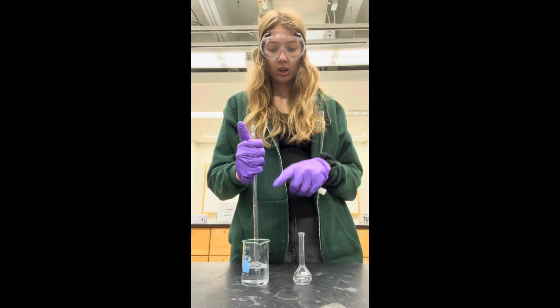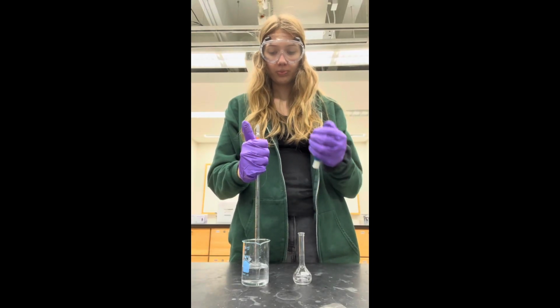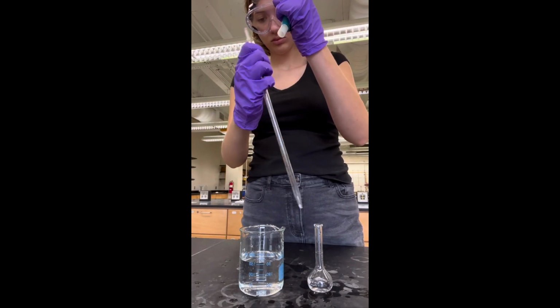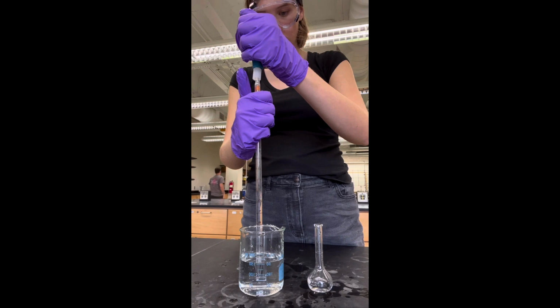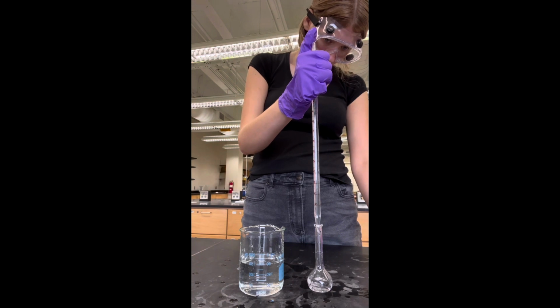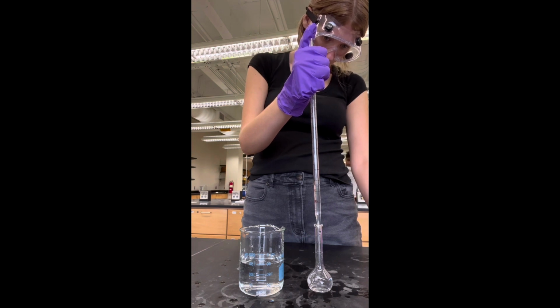Now I'm going to use water to dilute my dilution 2 up to the 25 milliliter mark. As you can see, I'm further diluting the already diluted stock solution in the flask. A stock solution is a concentrated solution of a known concentration that will be used for diluting. The diluted solution is a solution where water has been added to a certain amount of the stock solution in order to decrease the concentration and therefore dilute the stock solution.